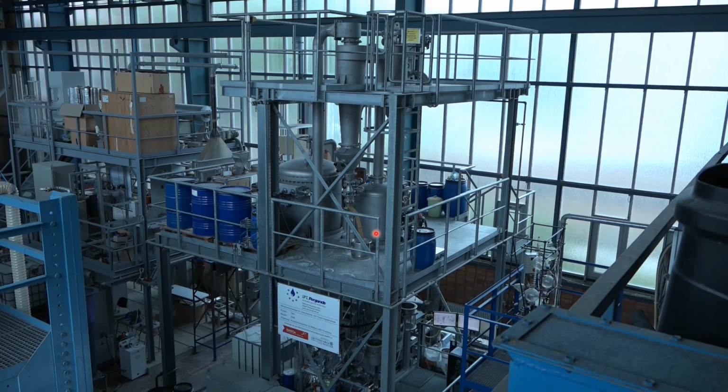This is this one, and then the process gas is going more upwards through a cyclone, where we are able to recycle the collected dust back to the process chamber, and then the process gas is going through a huge filter, and then the gas can leave the experimental hall, or we can even use the process gas in a cycle.